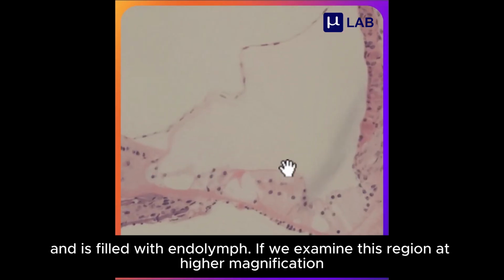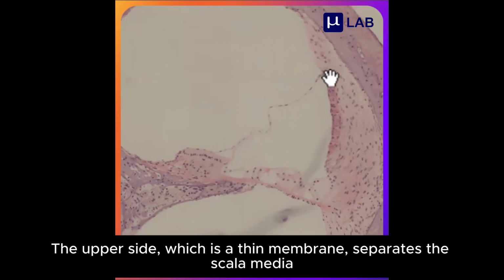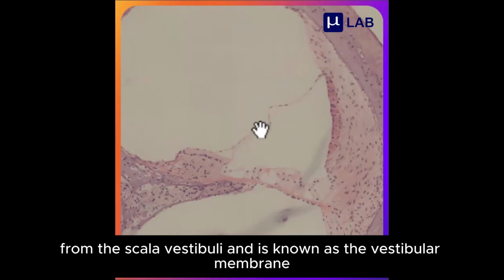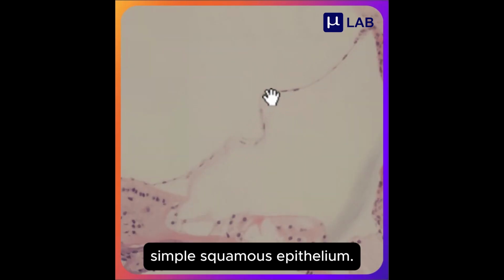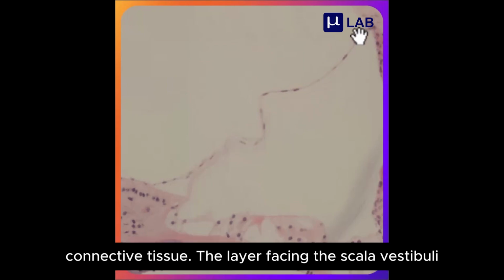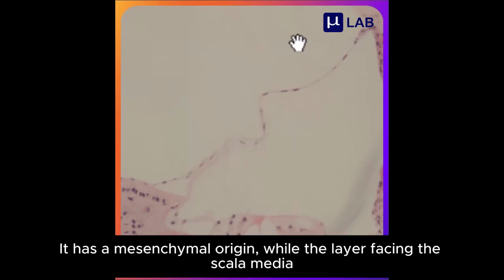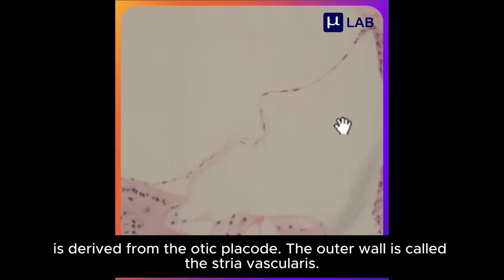If we examine this region at higher magnification, we can see that the scala media in cross-section looks like a triangular shape with 3 sides. The upper side, which is a thin membrane, separates the scala media from the scala vestibuli and is known as the vestibular membrane. The vestibular membrane is composed of 2 layers of simple squamous epithelium, as you can observe here. Between these 2 epithelial layers, there is also a thin layer of connective tissue. The layer facing the scala vestibuli has a mesenchymal origin, while the layer facing the scala media has an ectodermal origin and is derived from the otic placode.